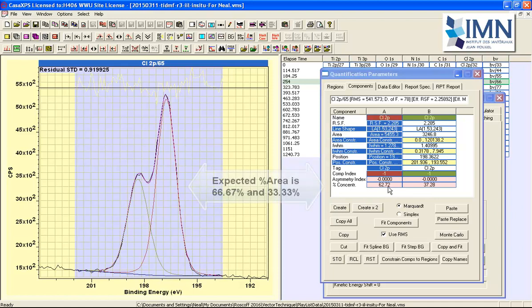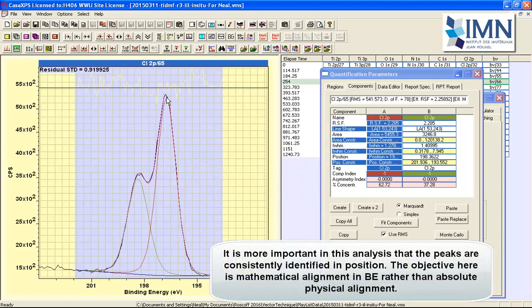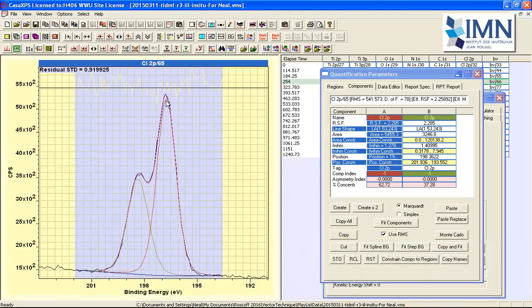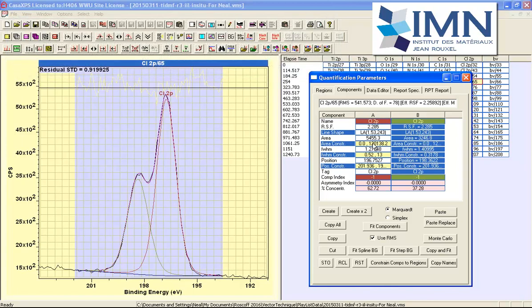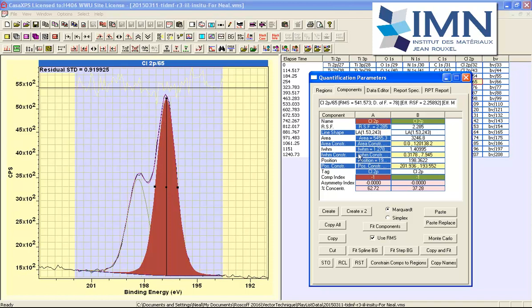The ratio of the peaks we'd expect to be 2 to 1, so the peak model as it stands has not produced the expected ratio. But that may not be an issue, provided these represent the shape that we actually see in these data, and that's what we need. We need to be able to identify a peak maximum for one of these components that can be consistently calculated for all of these data. Ideally, we would have the best peak model possible for this exercise. We would like to establish this position in terms of the binding energy, so expecting the ratio of these peaks to be closer to the 2 to 1 ratio that is expected for a doublet with P symmetry, then we can try and adjust this model to improve this position.